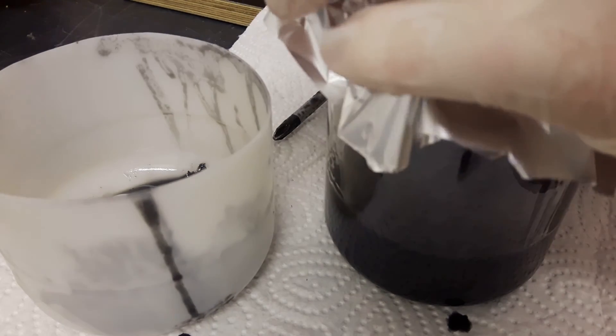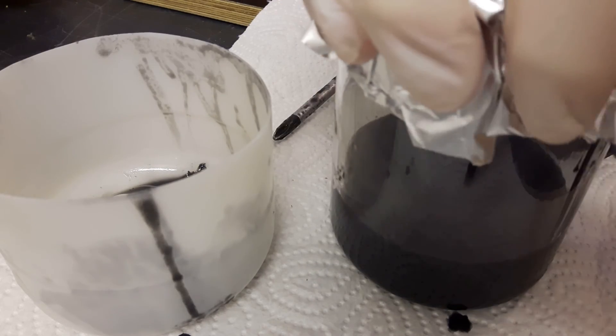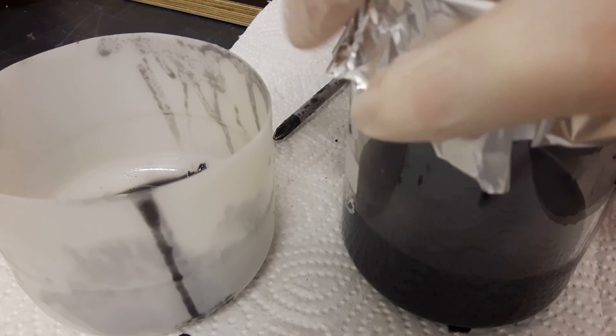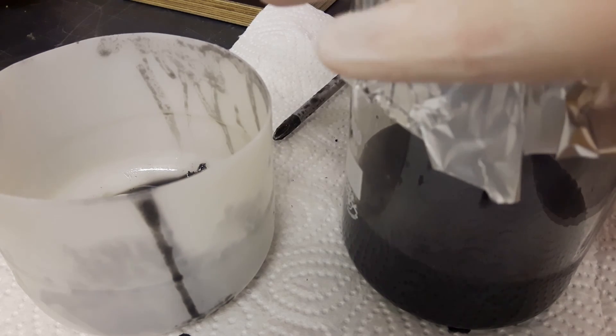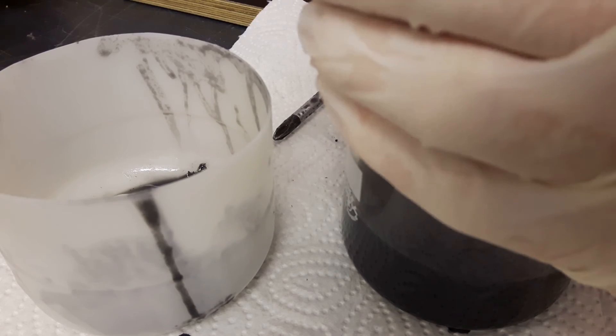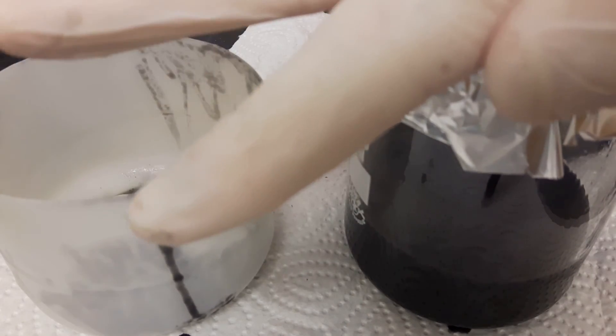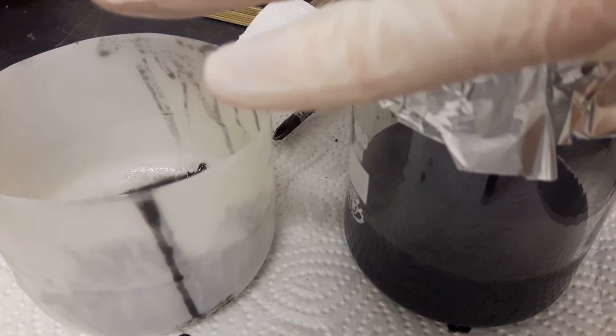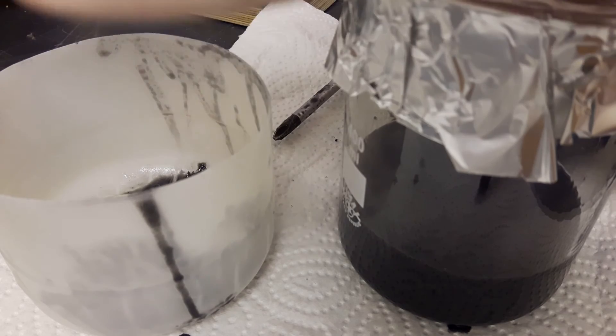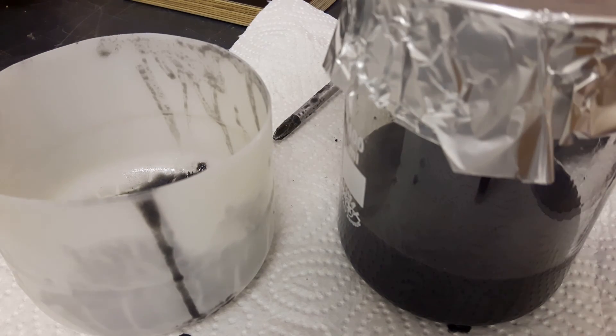Because if this enters your lung it will still decompose into aluminum oxide powder. And I don't know if this is really good. Because since it's gaseous it can go deep into your lung. And maybe this is a bit dangerous. So I was wearing a respirator this time. So it really stank that much because it's still hot. So I ran for the respirator and I probably flooded my workplace with toxic fumes. But since I was wearing a respirator this did not cause any harm to me supposedly.